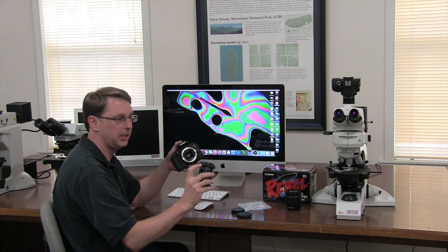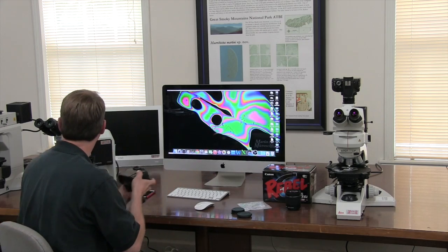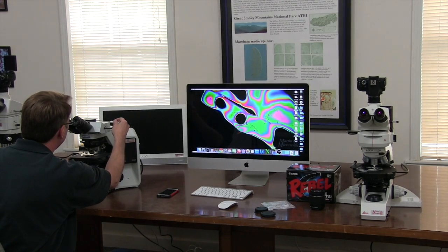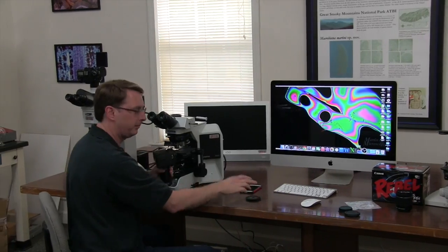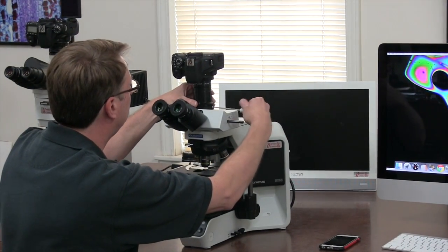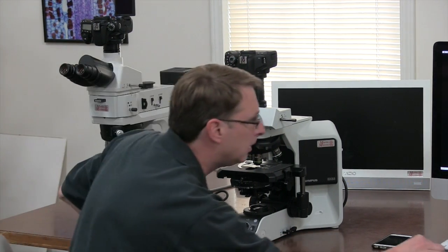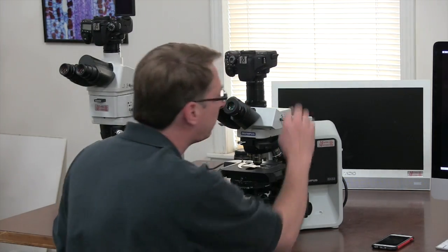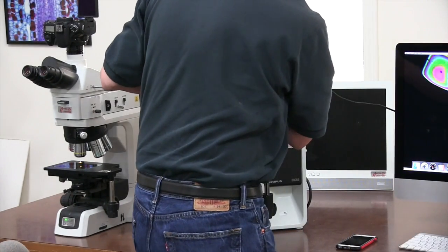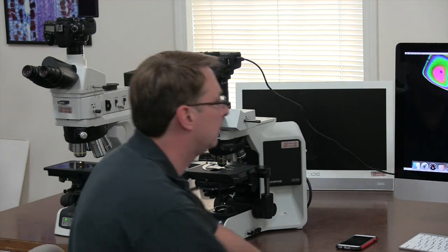This has a Canon T-mount on it. Red dot to red dot. I'm going to use the Allen set screw. Take this photo port cap off. I'm going to put the camera on. I'm going to set the control knob to P for program mode, and then I'm going to plug in my USB cable to my computer. Turn the camera on — the computer should see it.